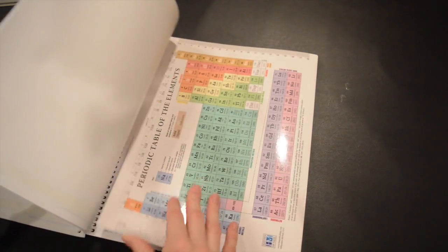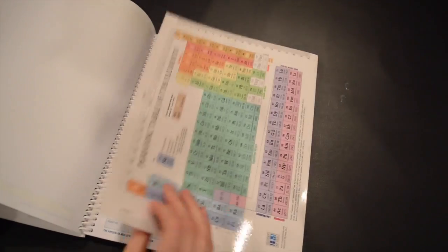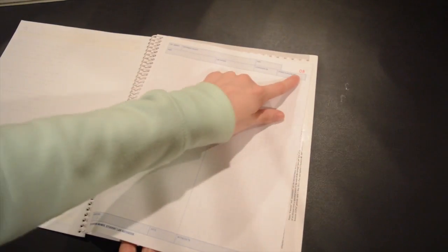The first step is to find the divider that's in your book — it usually has a periodic table on it — and you're going to place that between the two numbered page sets. In my case I'm placing it between page set eight and page set nine.